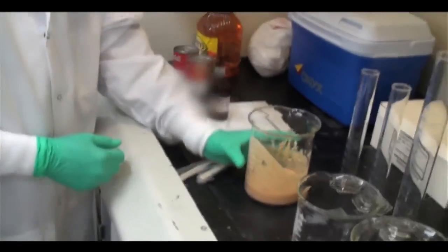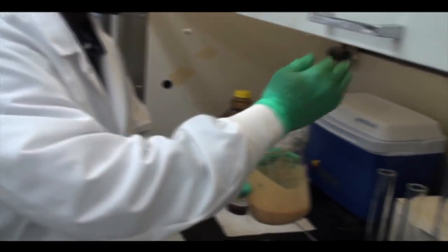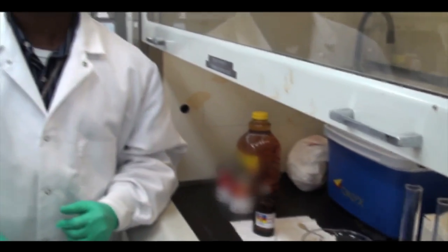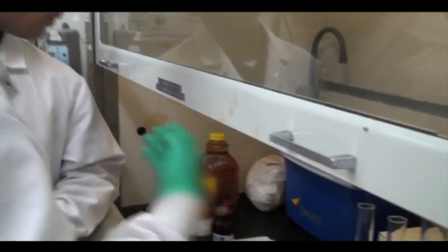Now we will add the flavoring agents, the smell. We're going to do it under the hood. What are you going to use for smell? The recipe that was given to us was two chemicals, isovaleric acid and butyric acid. We're using one percent solution of those and we're just going to add it dropper-wise until we think it's about right. It's going to smell bad. So what's going on? We're under the vent hood to take away the stink, so we don't have to smell it.